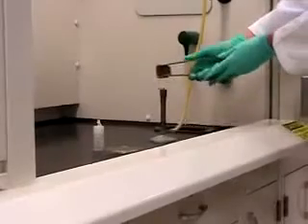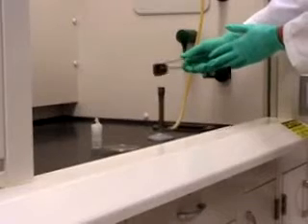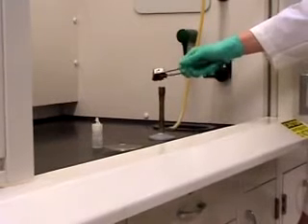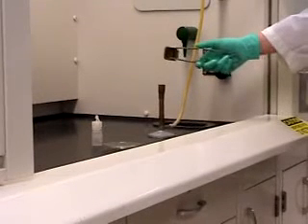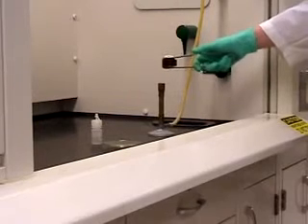Light a Bunsen burner. Have a striker ready over where the flame is going to be. Strike it a couple times to make sure that you get a spark, and then turn the gas on and start striking. If the burner doesn't start lighting right away, then turn the gas off and let it dissipate for a second, and then go ahead and try again.